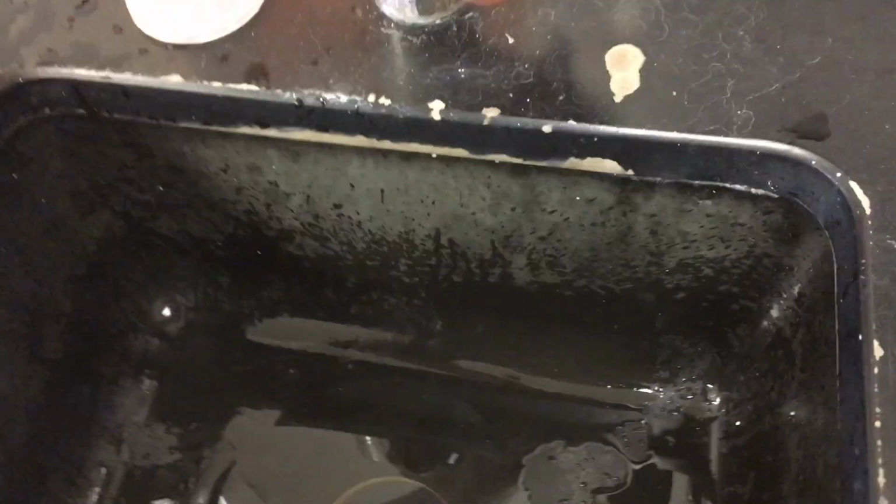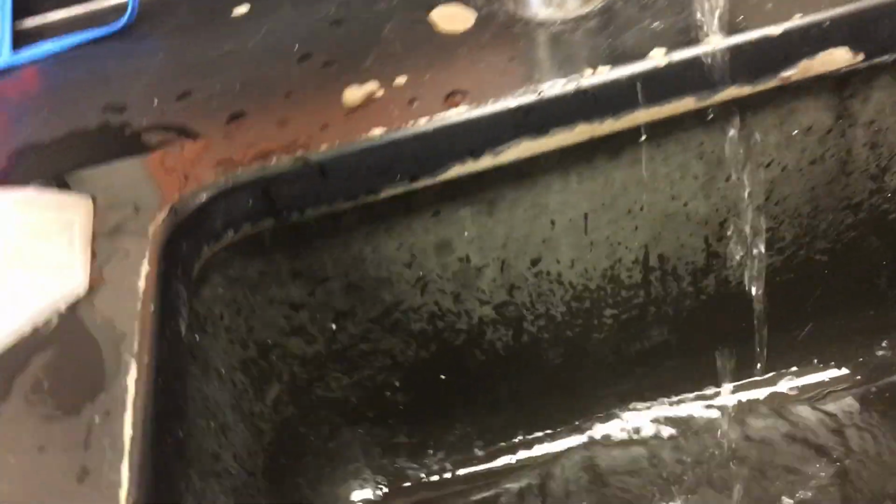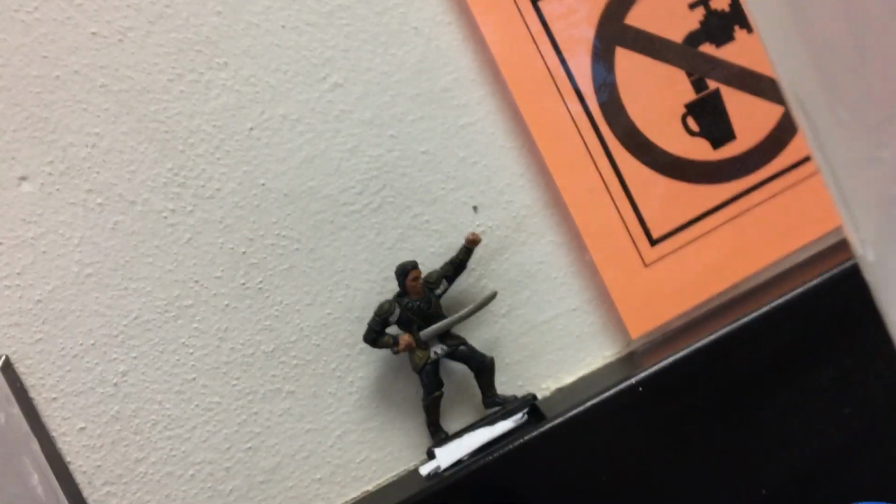All right, fits in this one. This will be good. Let's try it again. All right. So I'm thinking we're at, what do you think, 50, I'll go 52 on that.